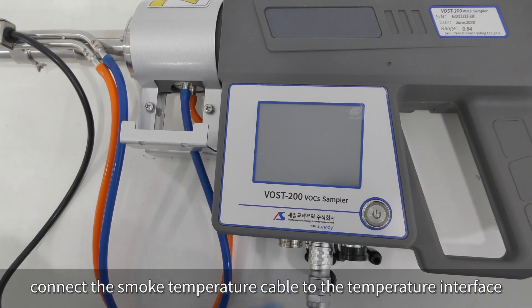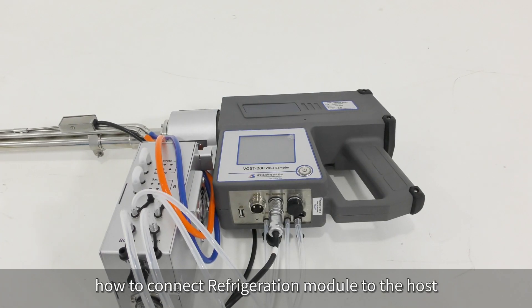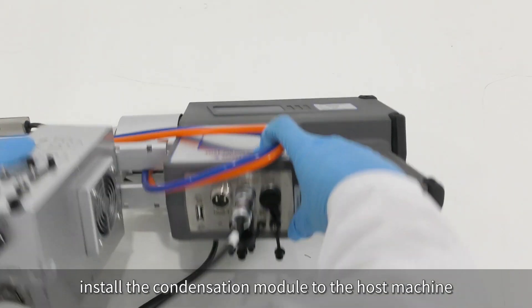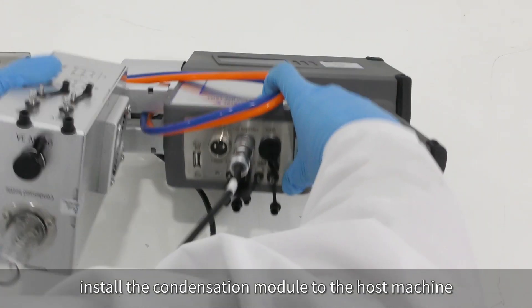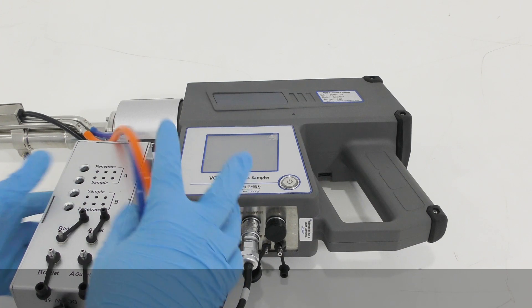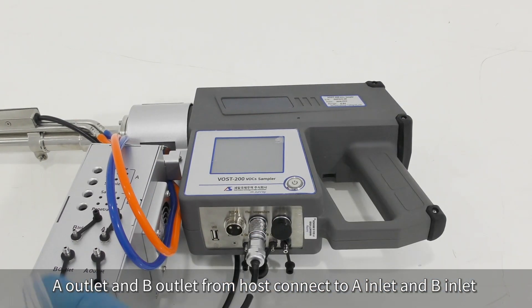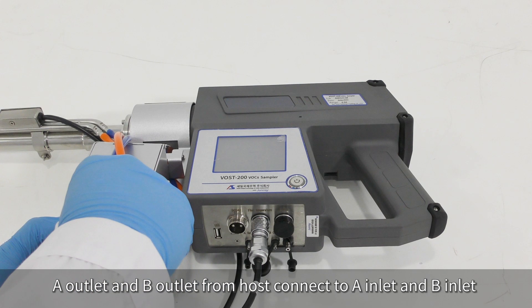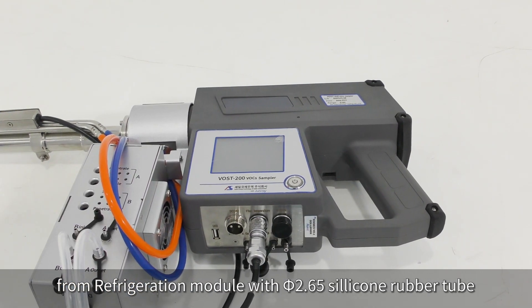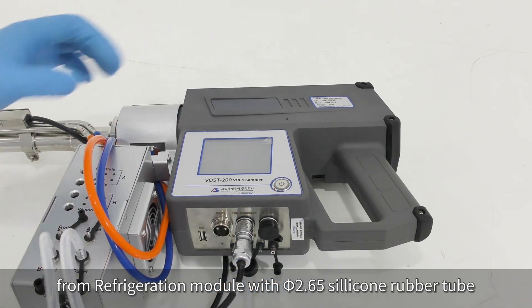Under working condition, connect the refrigeration module to the host. Install the condensation module to the host machine. The A-outlet and B-outlet from the host connect to the A-inlet and B-inlet of the refrigeration module using FI-2.65 silicone rubber tube.